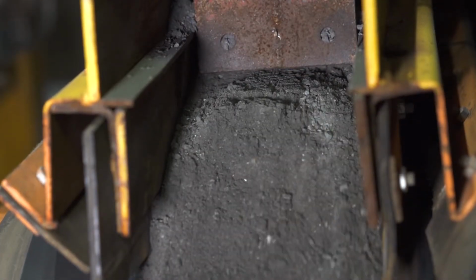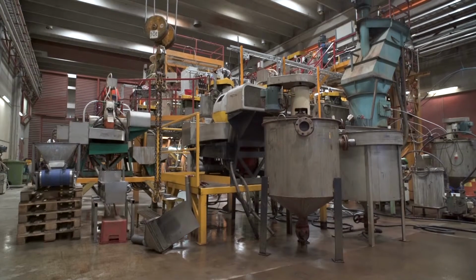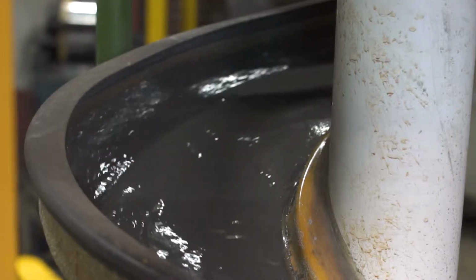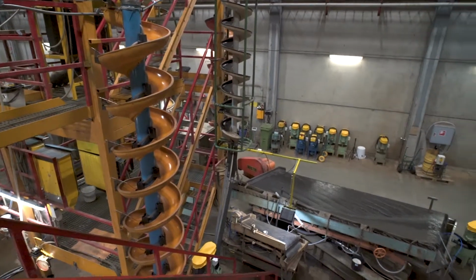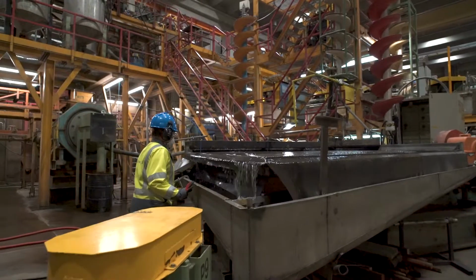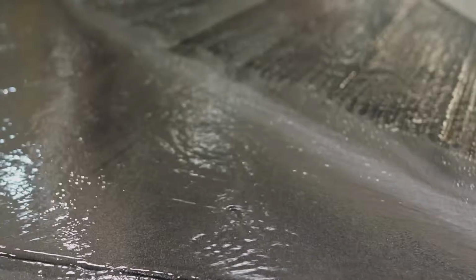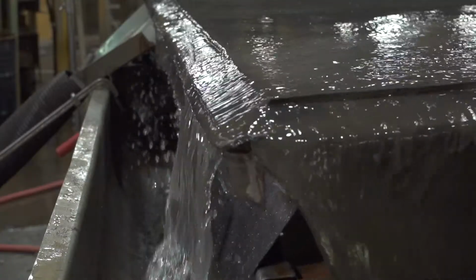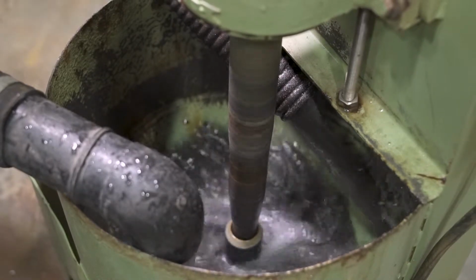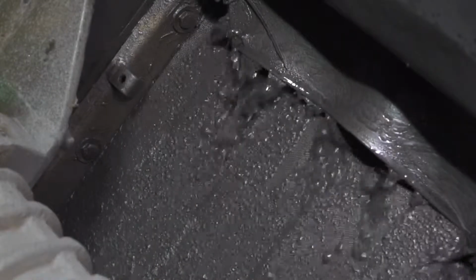The pilot plant of GTK Mintec comprises most of the unit concentration processes, which are normally included in concentrators worldwide. The plant unit processes crushing, grinding, classification, flotation, magnetic separation, gravity concentration, heavy-medium separation, and dewatering can be realized in many alternative ways within a reasonably short time to find out the optimum combination process.